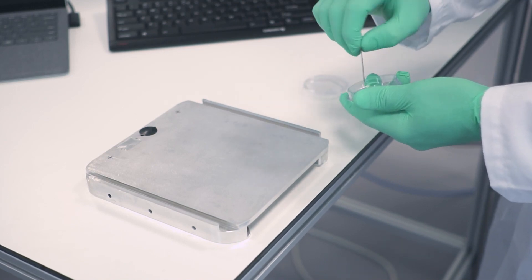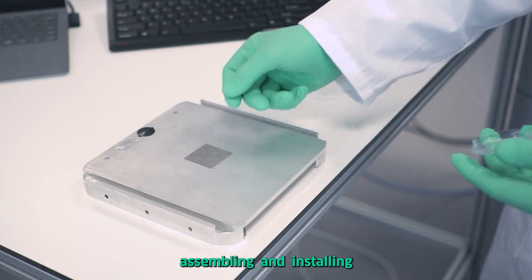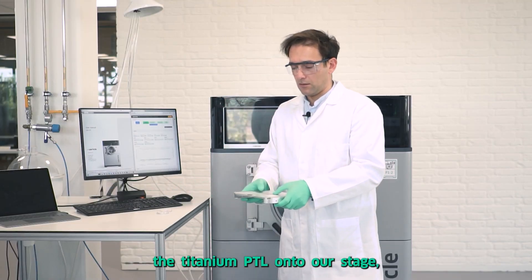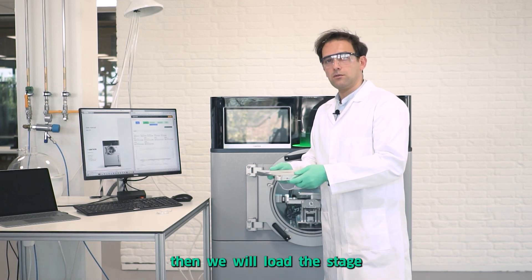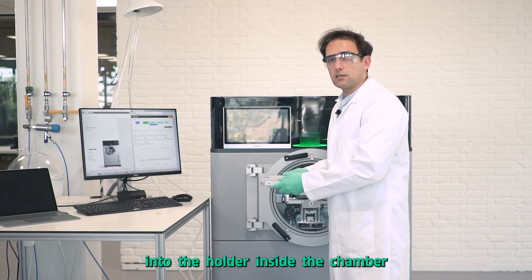After assembling and installing the titanium PTL onto our stage, we will load the stage into the holder inside the chamber.